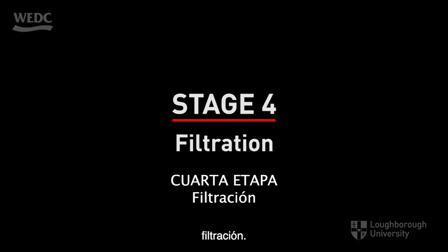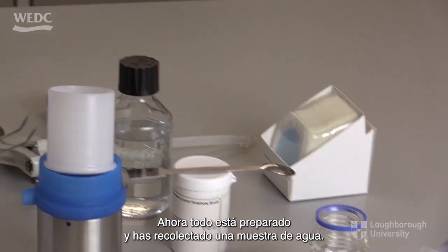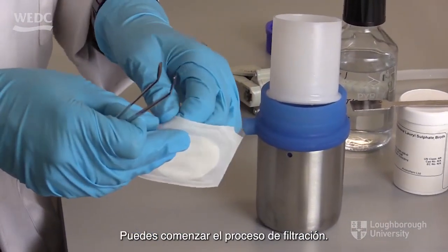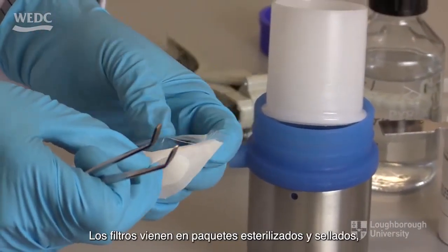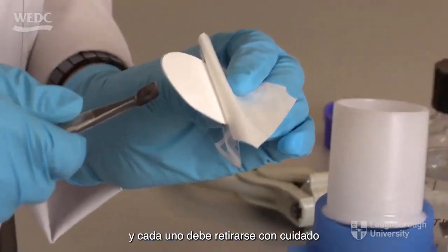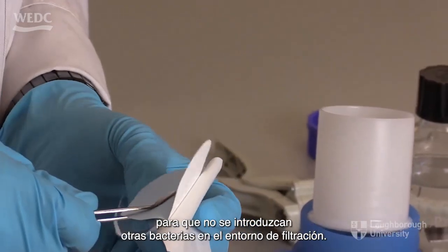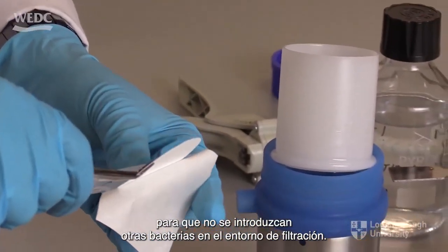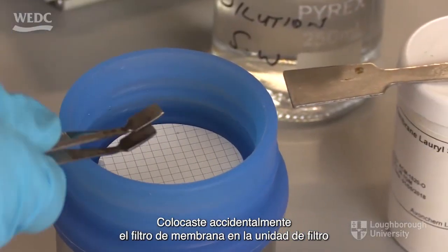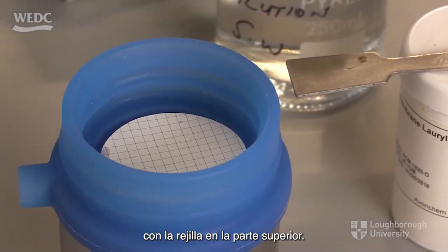Filtration. Now everything is prepared and you have collected a sample of water, you can start the filtration process. Filters come in sterilised sealed packs, and each one has to be removed carefully, so that other bacteria are not introduced into the filtering environment accidentally. Place the membrane filter into the filter unit with the grid on top.